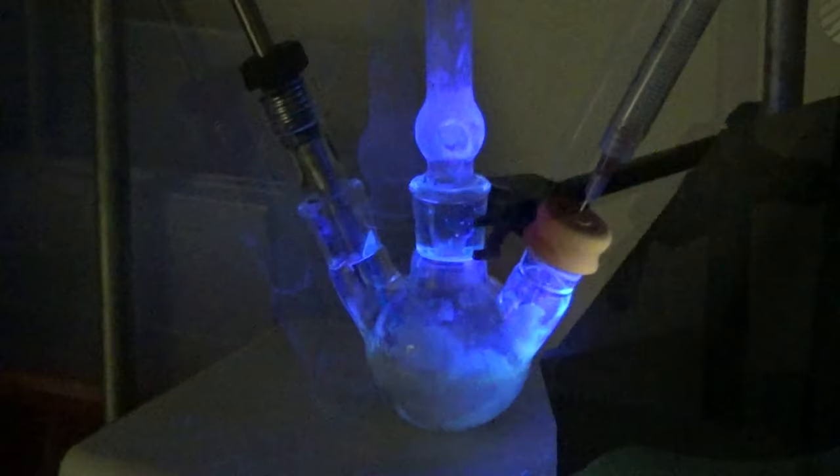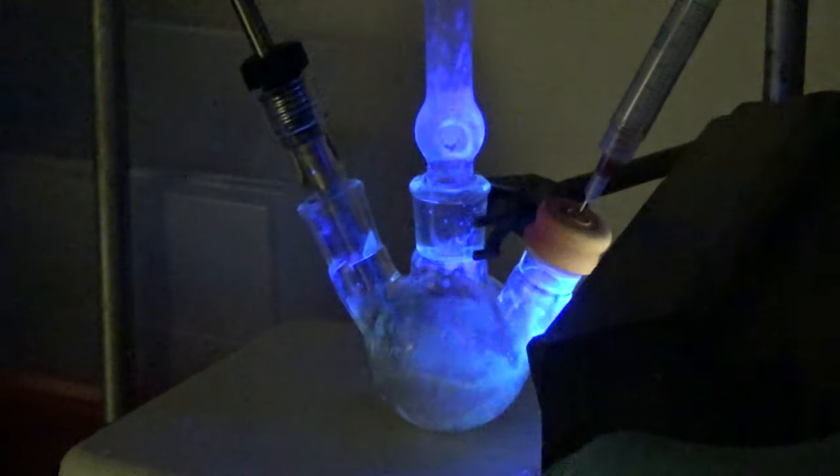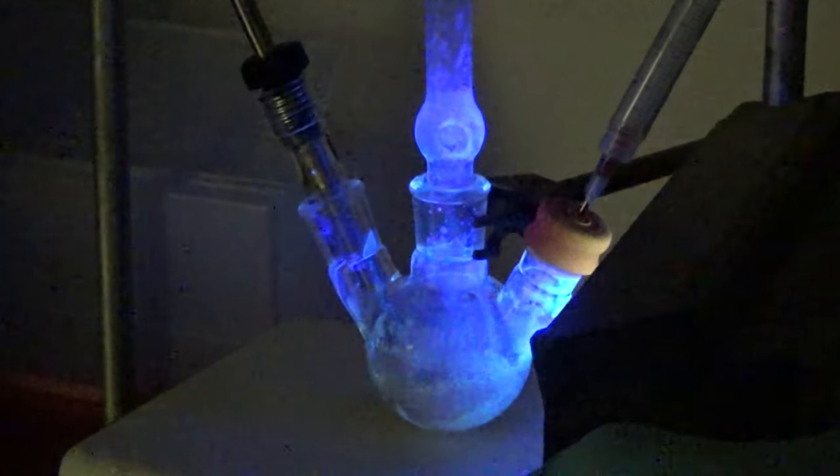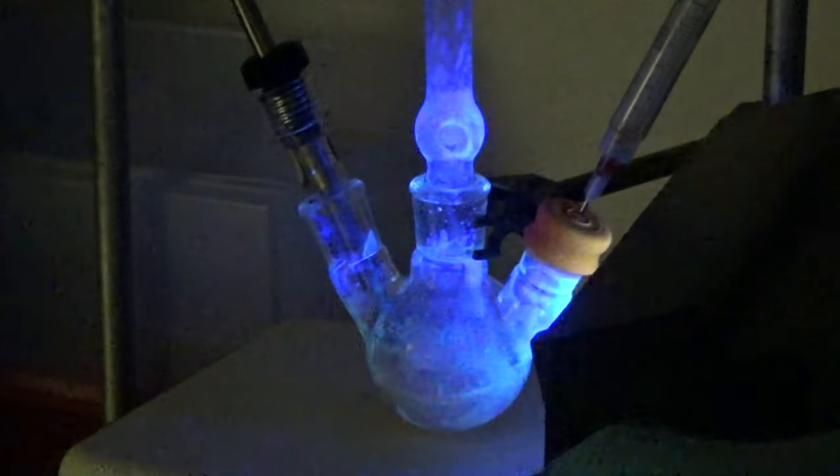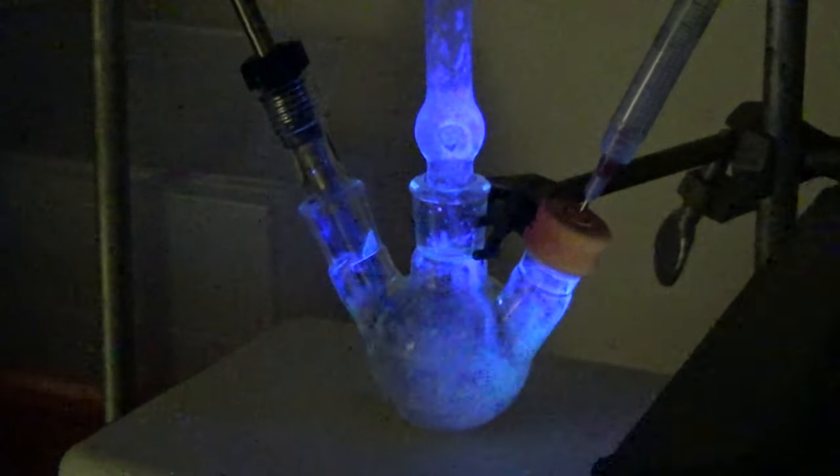It doesn't look great at all. But as it cools, voila, yeah, it's starting to look pretty good. As it cools and cools, that blue light is really starting to jump out at you.